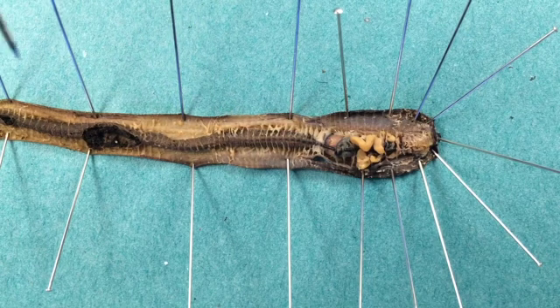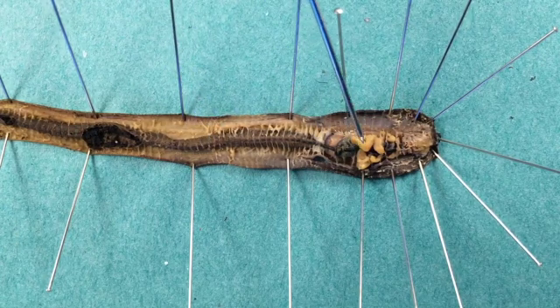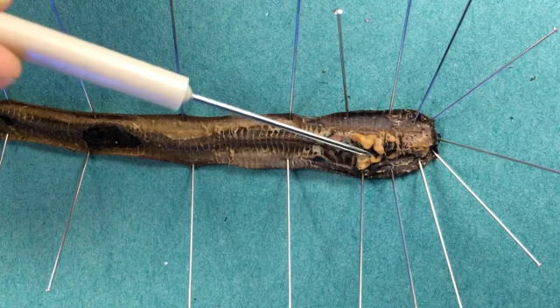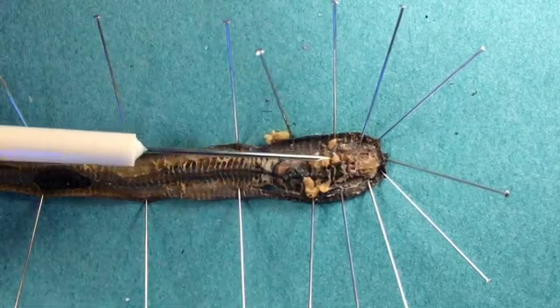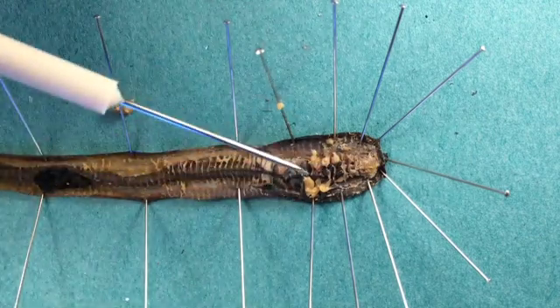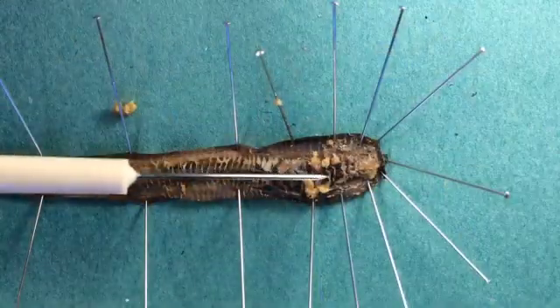This circulation is driven by two things: firstly, peristaltic contractions in the dorsal vessel, which take place about every two to three seconds; but also by pumping in the aortic arches, which we'll have a look at now. Aortic arches are contractile vessels which act a bit like pseudo-hearts. To see the aortic arches we need to move aside the seminal vesicles and seminal receptacles. There are actually five aortic arches in this species — one, two, three, four, five — and there'll be five on the other side as well.